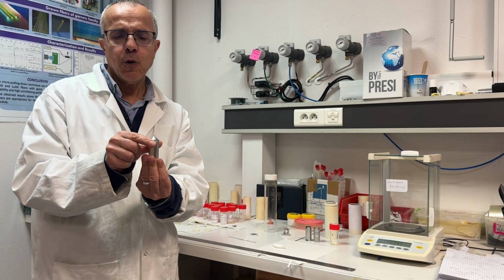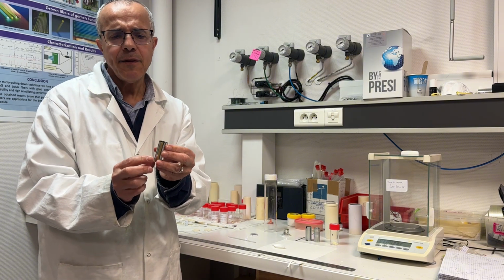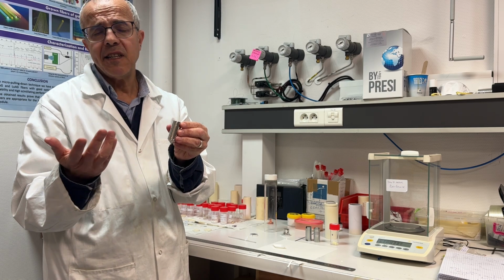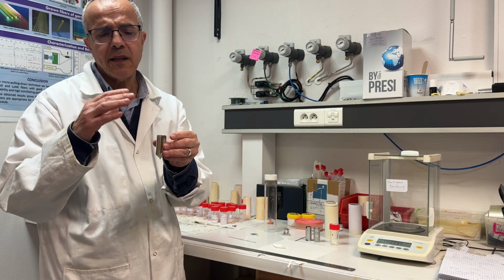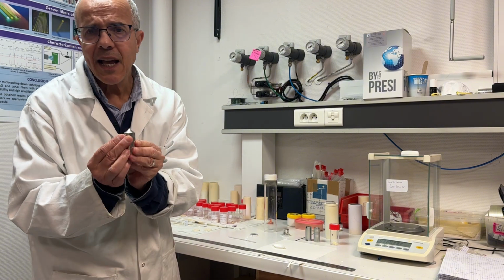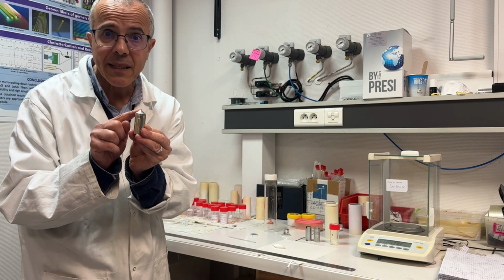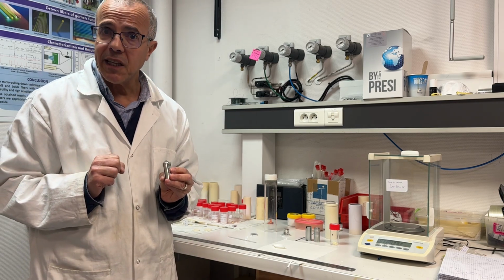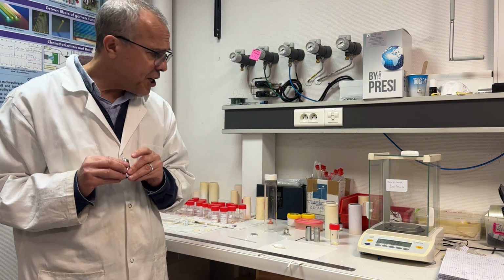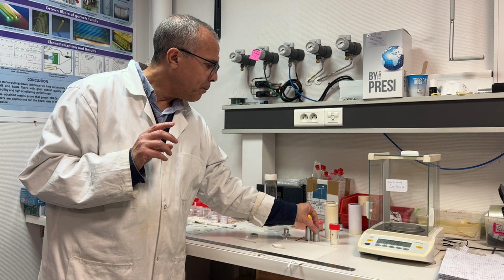In the crucible we can put the material you see here, and it has a special shape. It was designed to generate the shape that we need. That is, as I told you, an example of a fiber shape. But with the micro pulling down technique, we can also prepare plate shapes. I show you another crucible which allows us to obtain a plate shape.